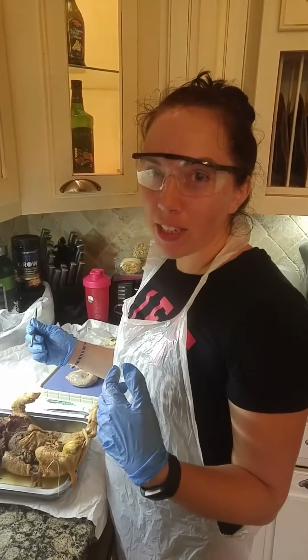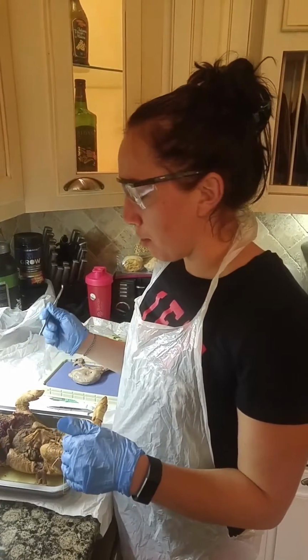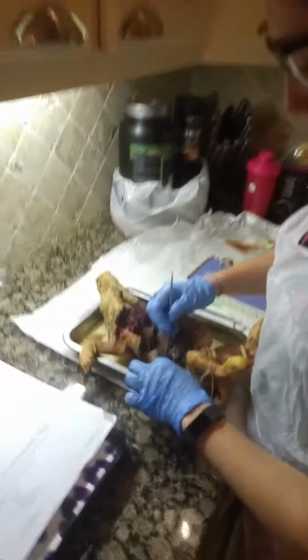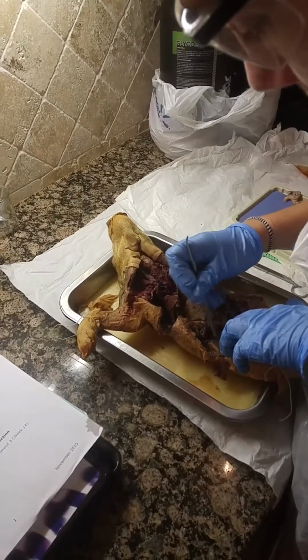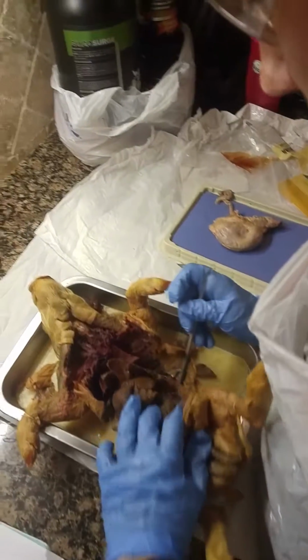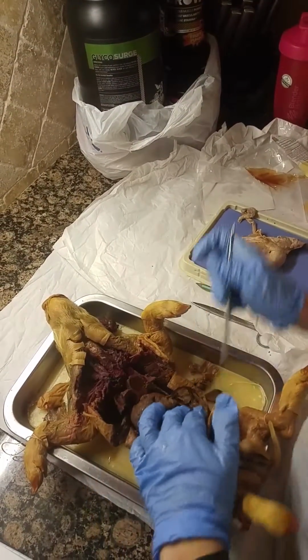This is my lab report 6 for anatomy and physiology, the urinary system and reproductive system of the fetal pig. So to identify the kidneys of the pig, they are posterior, behind the small intestines. Here on the left-hand side, this small bean-like sac, and then on the other side back here is another bean-like sac. Those are both the kidneys.